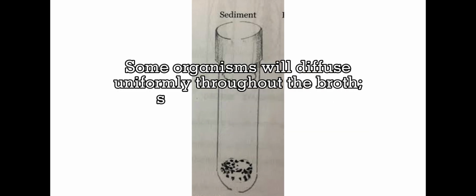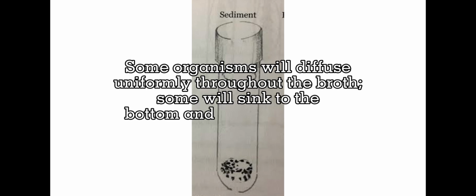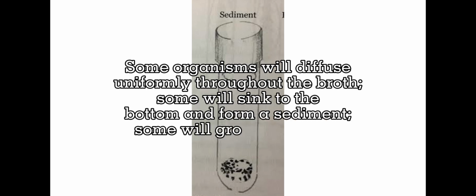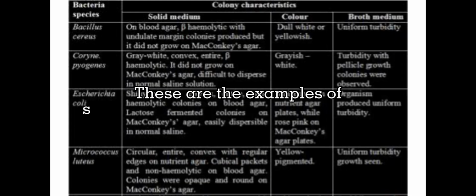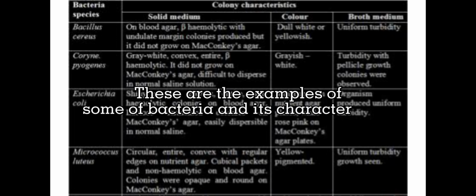Some organisms will diffuse uniformly throughout the broth, some will sink to the bottom and form a sediment, and some will grow in clumps, producing a flocculent growth. These are examples of some bacteria and their characteristics.